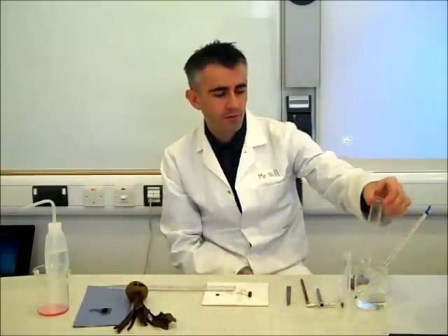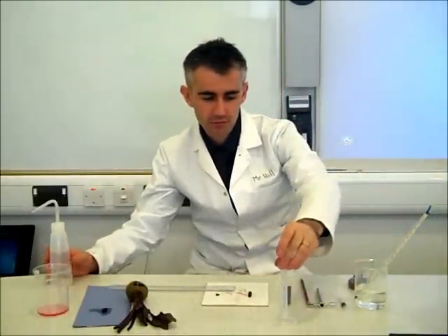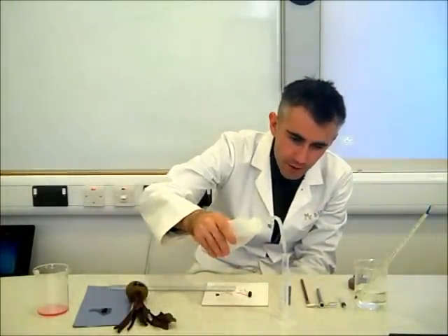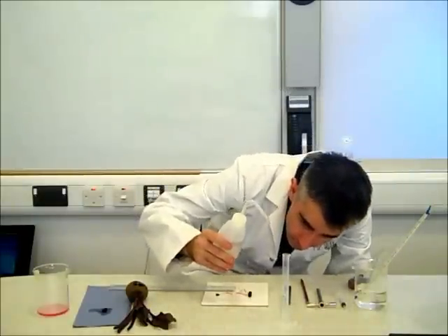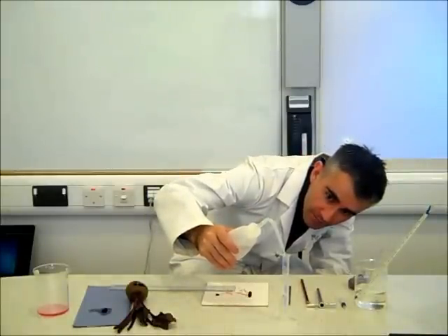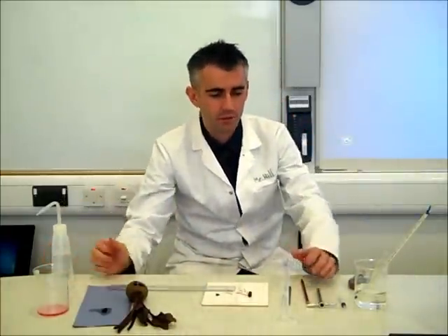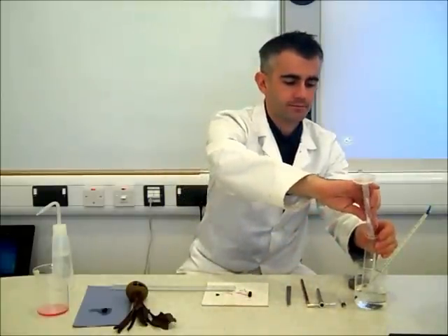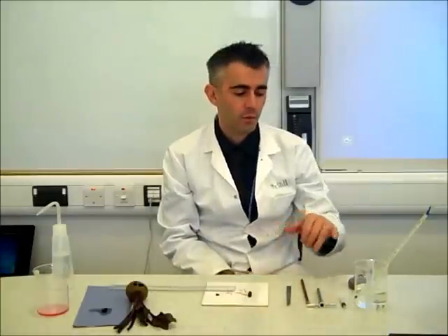At the moment the boiling tube doesn't contain any liquid. I'm going to measure out five centimetres cubed of distilled water — again purposely using distilled water. Reading the meniscus carefully, I'll add it drop by drop as I approach five. There we go, exactly five centimetres cubed of distilled water added to the boiling tube. I'll now leave that for a minute so the water inside the boiling tube comes to the same temperature as the water bath surrounding it, which is 50 degrees Celsius.